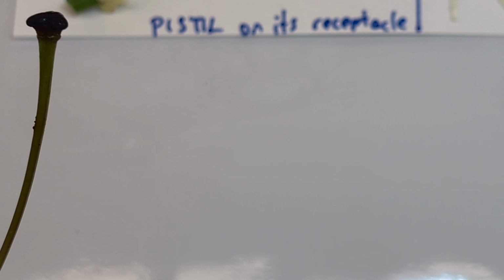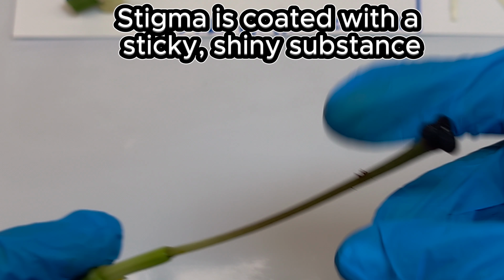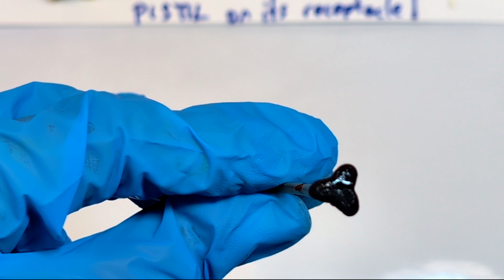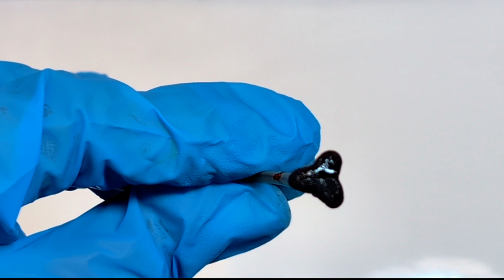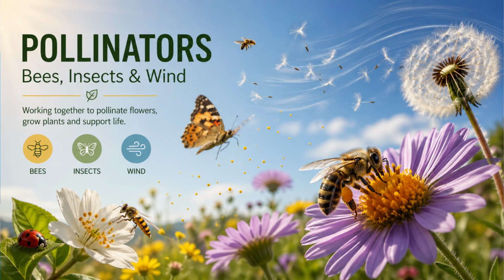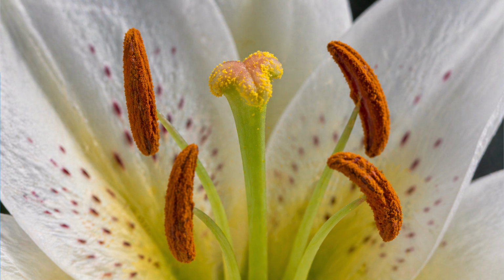The stigma often looks enlarged or textured. It is coated with a sticky, sometimes shiny substance. This stickiness plays a crucial role in reproduction. When pollen grains are transferred to the flower, usually by insects, bees, or by wind, they need to land and stay in place long enough to begin the process of fertilization.